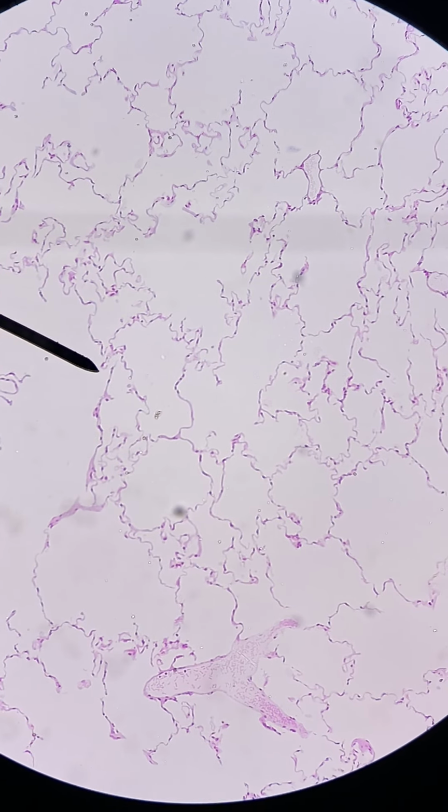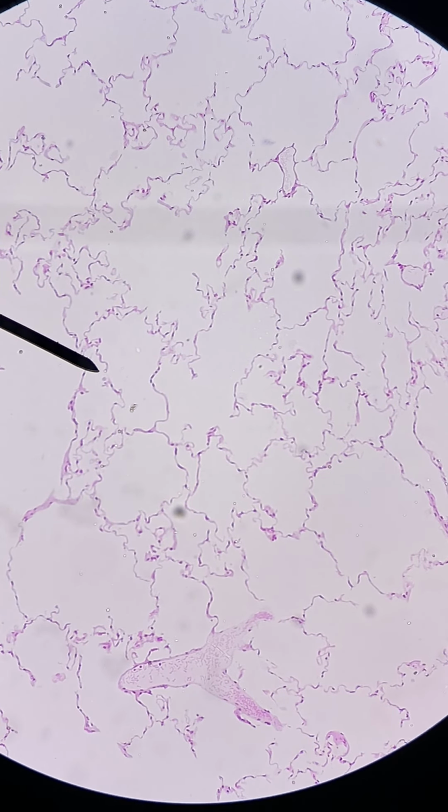This shows the alveoli really well. In your lab book, it tells you to know bronchioles, alveolar sac. An alveolar sac is just a bunch of alveoli. An alveolar duct is a duct that goes into an alveolar sac, but I'm not going to ask those on the quiz or the test. So do know that those circular or enclosed spaces are, for our purposes, alveoli.